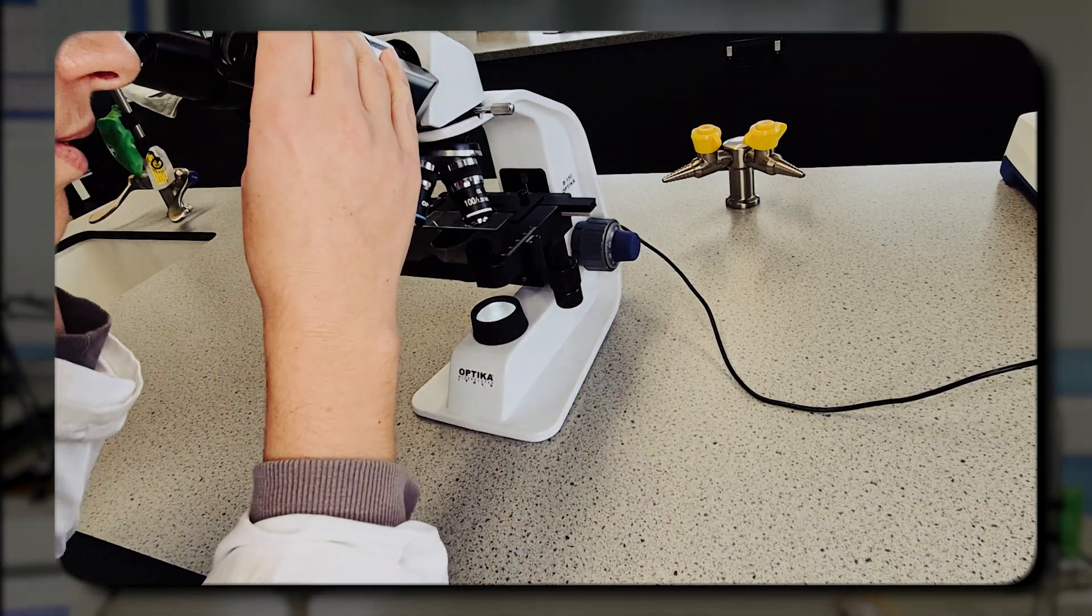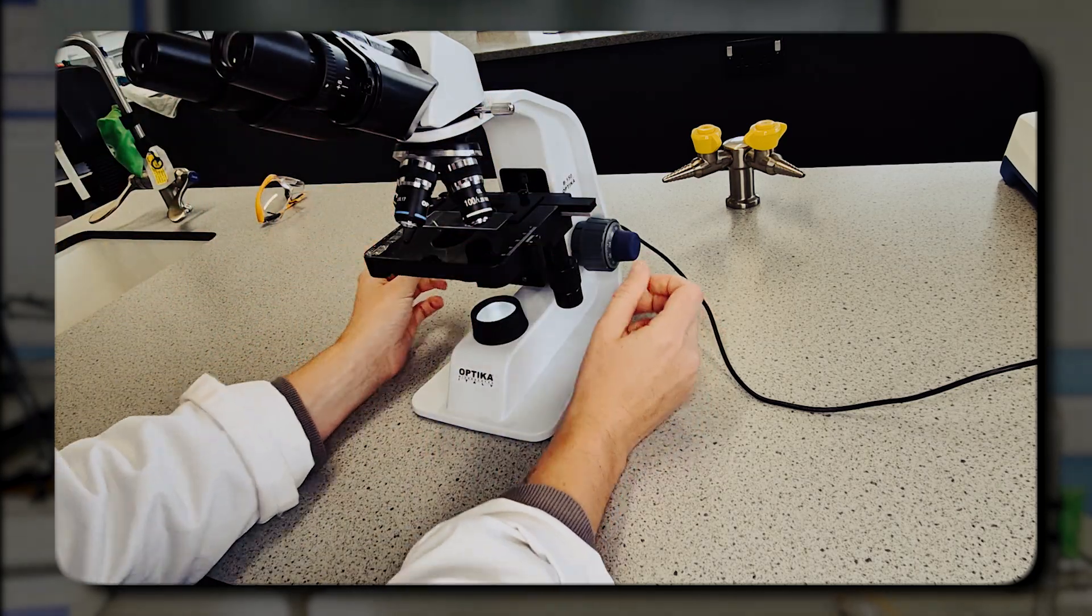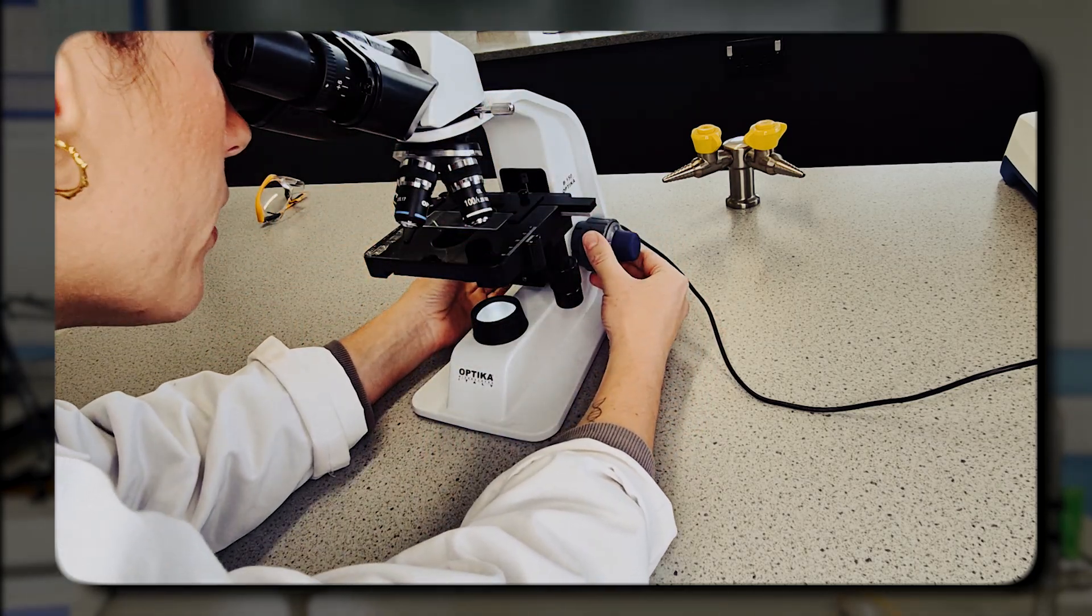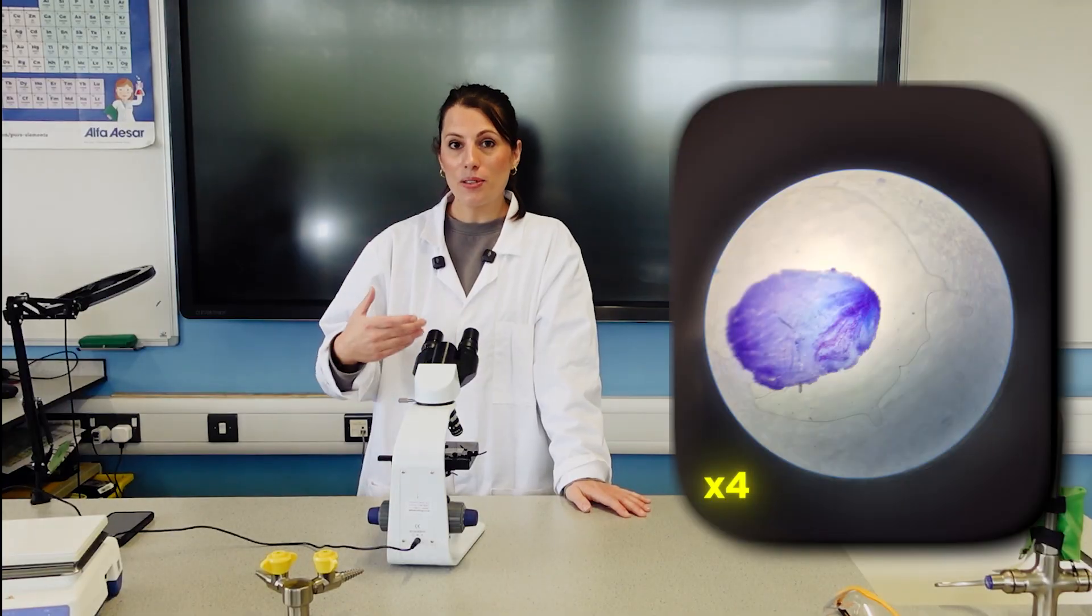I'm moving it so I can see that is now in the right position. And have a look through. I just need to focus a bit.